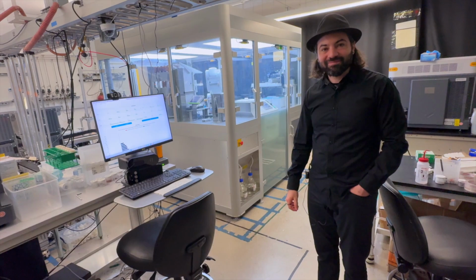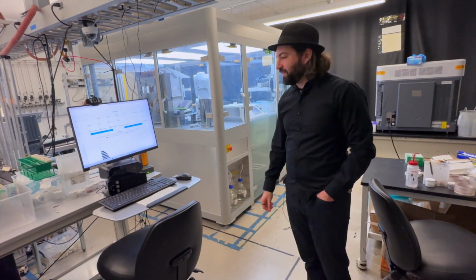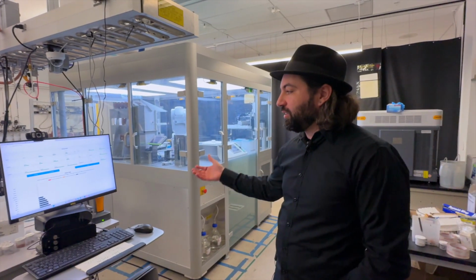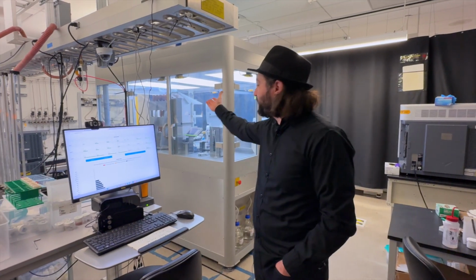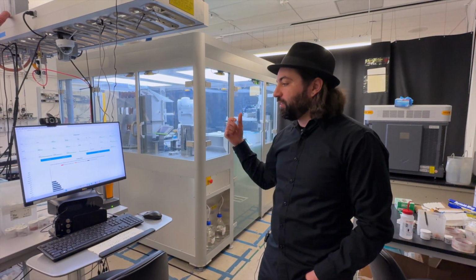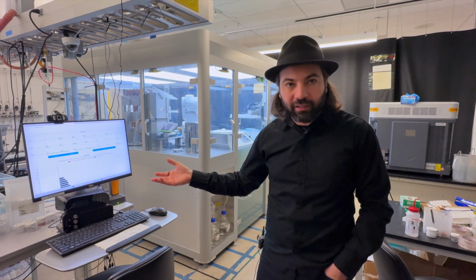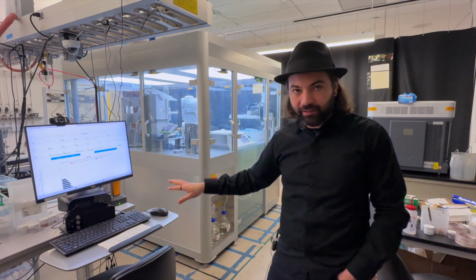Awesome, well here we are in the A-Lab. David, thanks for having us. Show us around. What are we looking at? All right, so here, this is the computer where everything starts. You come here, for example, to set what is in the dosing head, so the materials you are going to use for your synthesis. Then in this computer, you can also set the experiment you're going to run. So everything starts here. You submit your experimental data here.